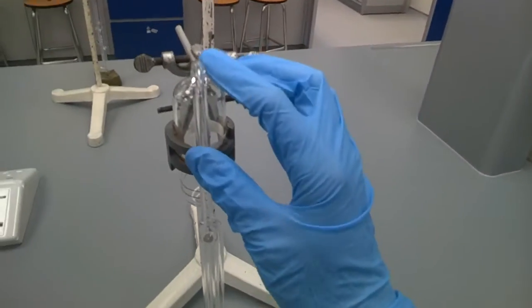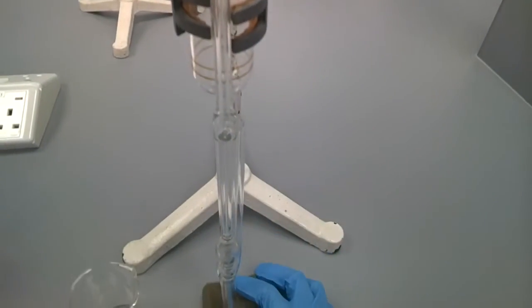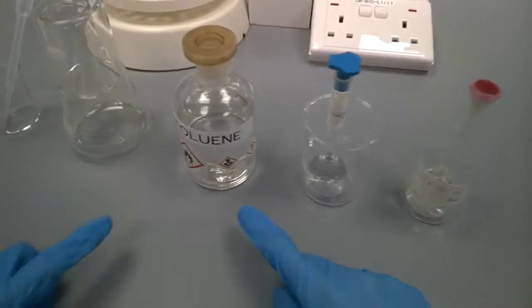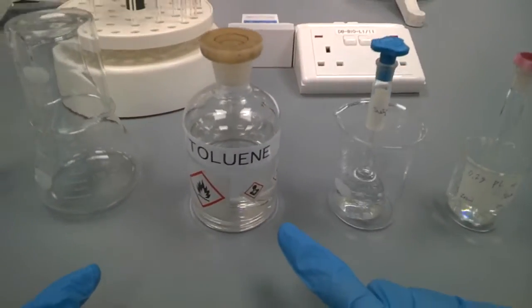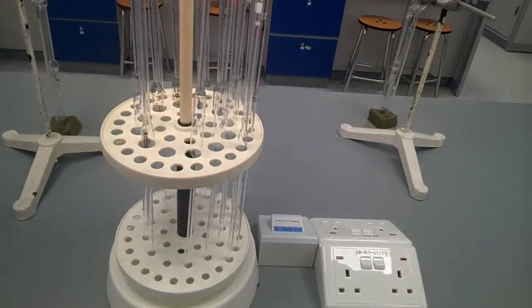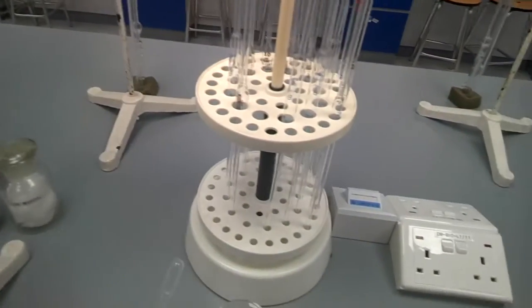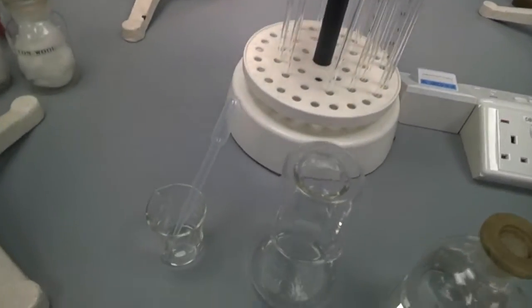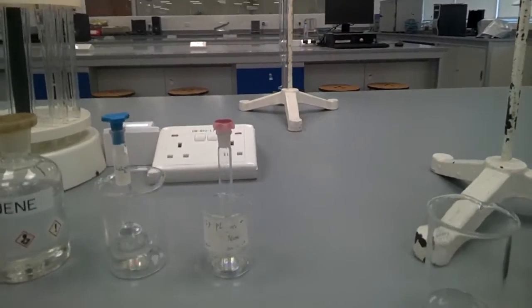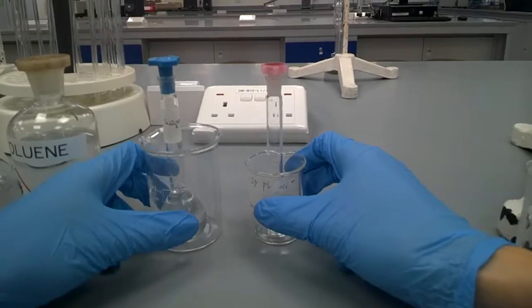Seal the bottom part. Toluene is our solvent here, so you need to have a bottle of it and some pipette, 10 ml pipette, to top up the solution here using some dropper, spare beaker, conical flask, and of course here you see our polymer solution that we have prepared from suspension polymerization.